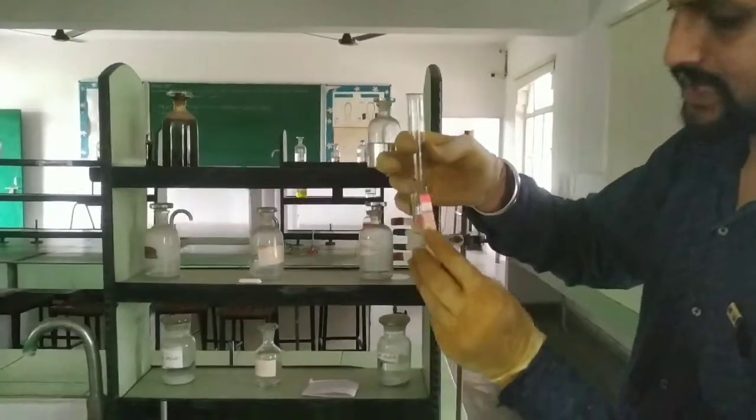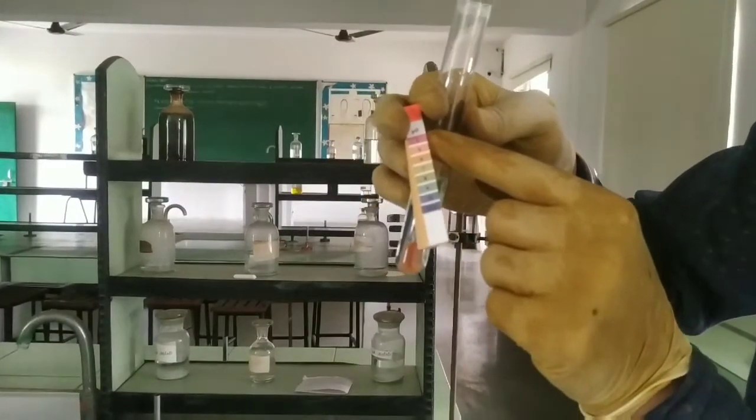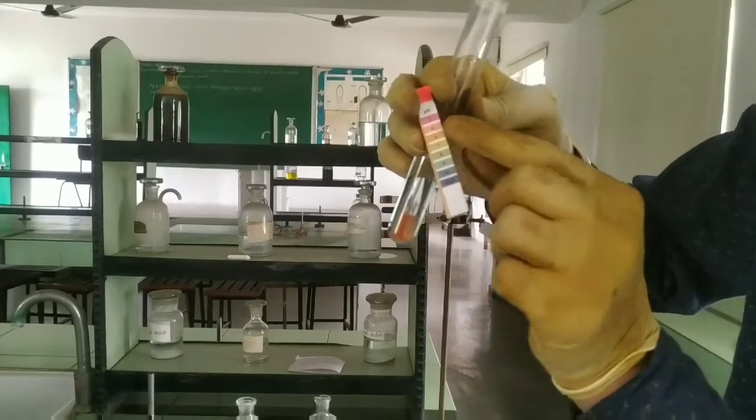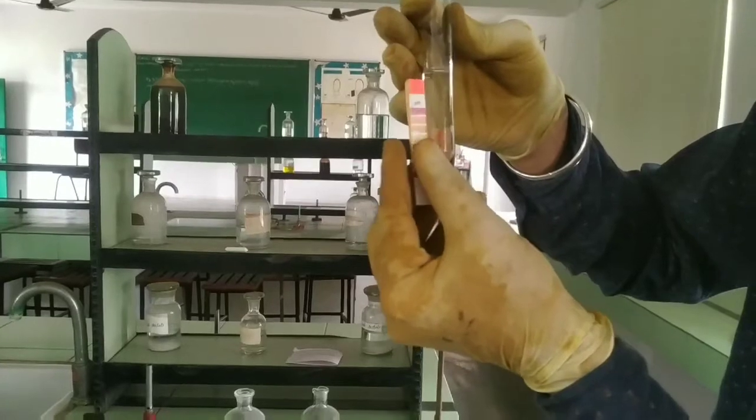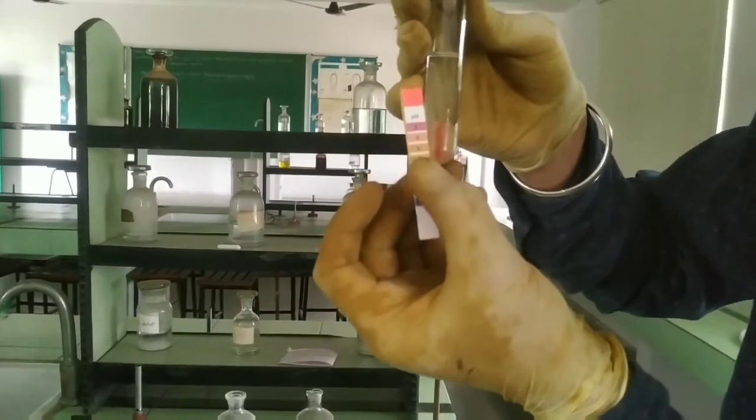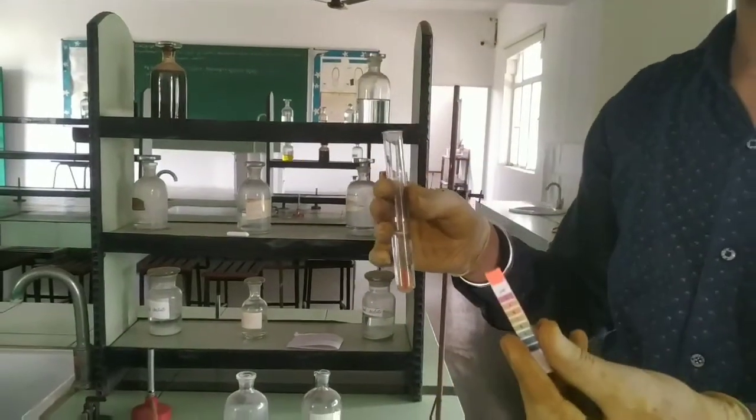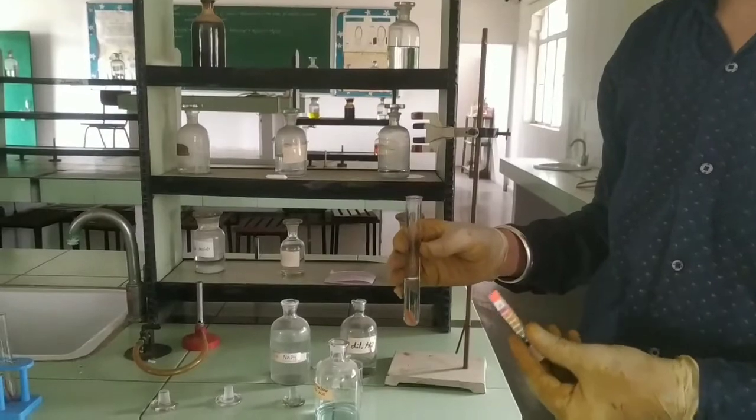The color of dilute HCl is pH 2, meaning dilute HCl is a more concentrated or strong acid, whereas the pH for acetic acid is 6, which proves that this is a weak acid. So this is our experiment in which we determined the pH of various samples.